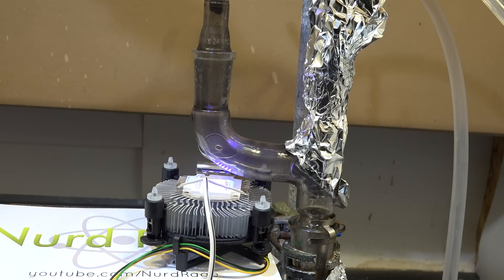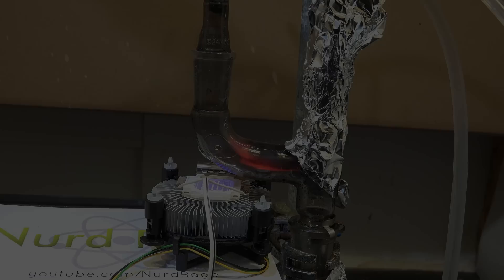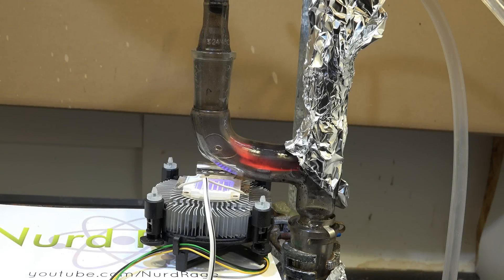Now you'll notice the Claisen adapter being filled with black soot. This is because we're having small chlorine fires and you can see them as tiny little orange flashes. Did you miss it? Let me freeze frame on one of the flashes. That orange streak is a chlorine fire. I'm adding too much chlorine too fast and that's creating a mixture rich enough to burn.